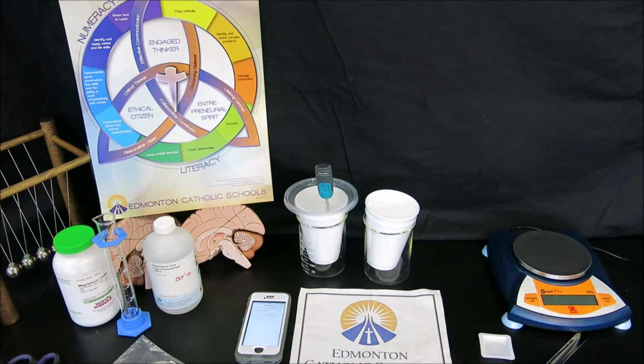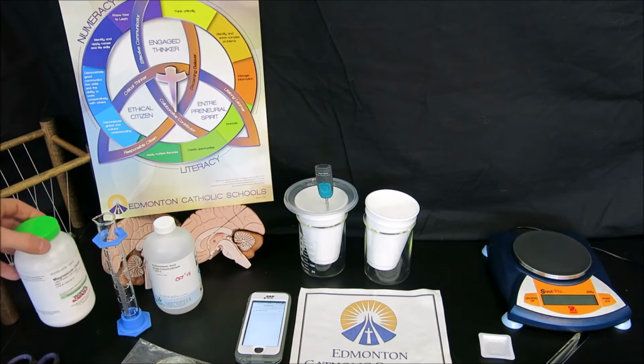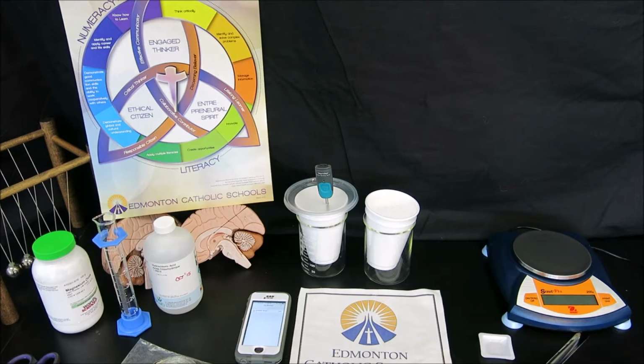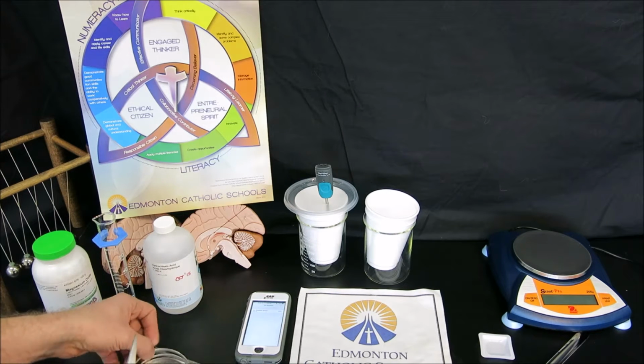So instead, we'll be using additivity in the sense that we will be doing two separate reactions, one with magnesium and one with the product of its combustion, which is magnesium oxide, and we'll be mixing these into separate calorimeters with hydrochloric acid. Each of the reactions will be measured by a thermometer, and then we can take the enthalpy calculated values and solve the enthalpy of combustion using additivity. In order to do that, we're going to have to do two different reactions.